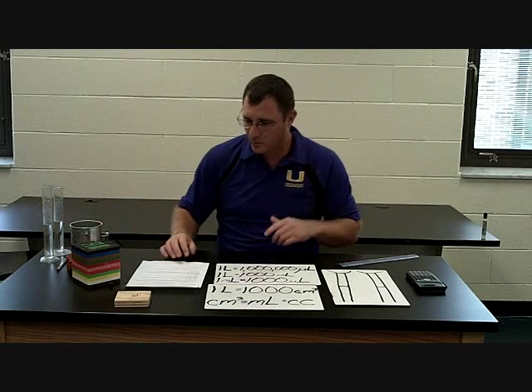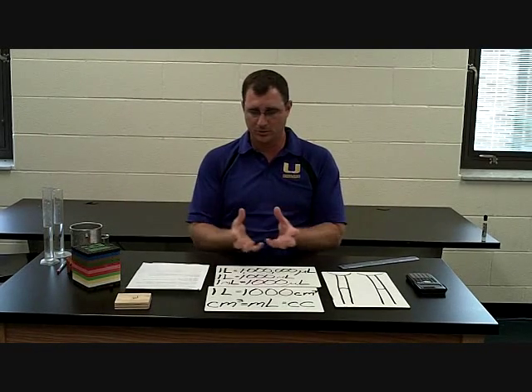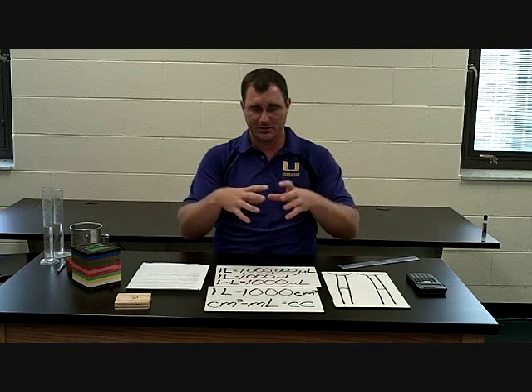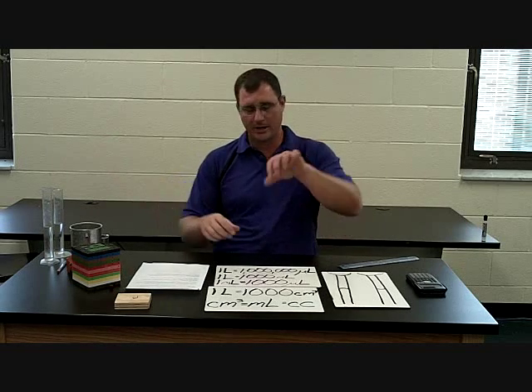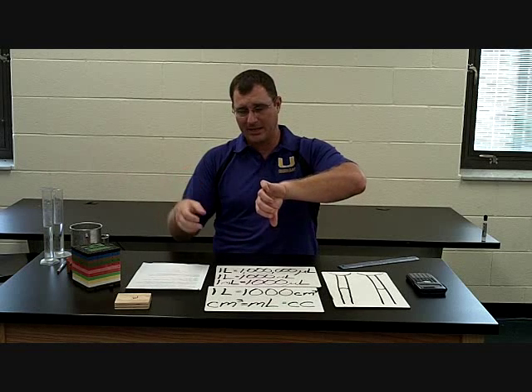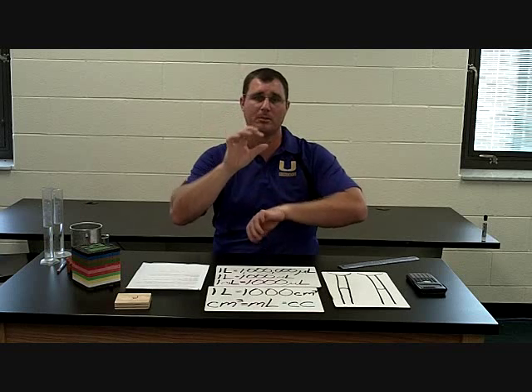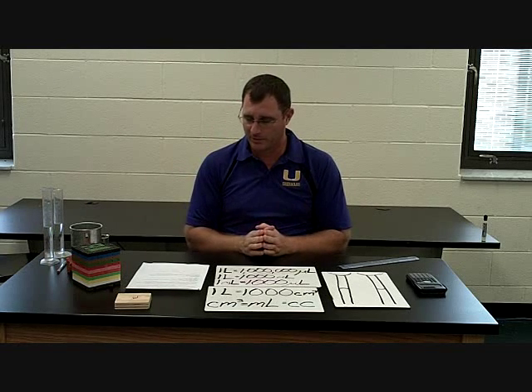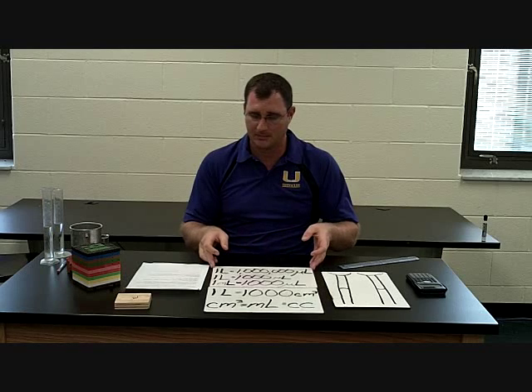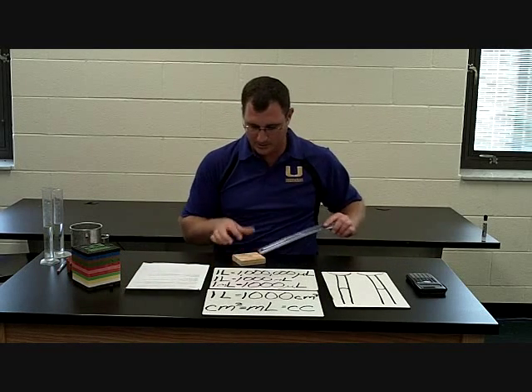With gas, we're not going to do this in this lab, so I'm not going to talk a lot about it, but we will do it in the gas law lab. You use a pneumatic trough — it's a little trough full of water and you turn a graduated cylinder upside down, and basically the gas bubbles up and it pushes the water down, and you can measure the displacement that way. We'll cover that in the gas law lab.